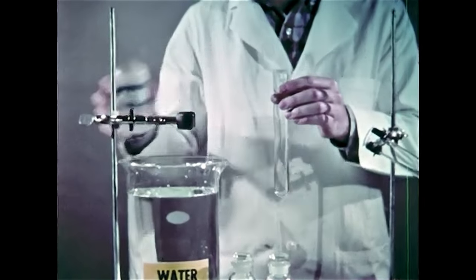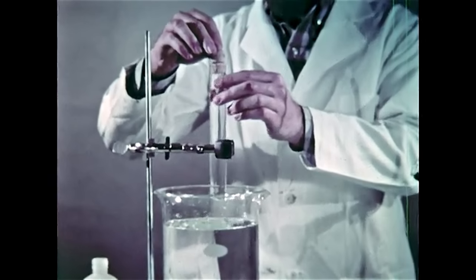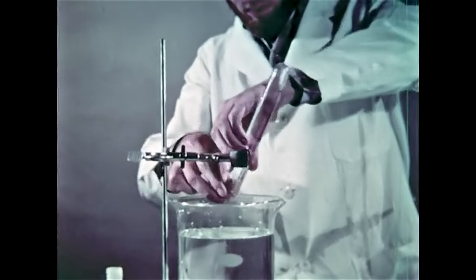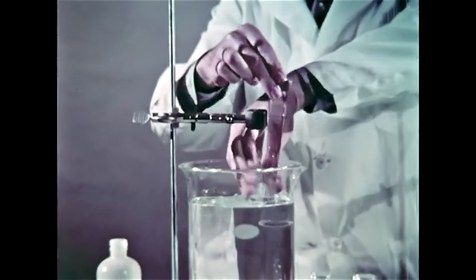By having a tube filled with water for collecting, we avoid mixing the oxygen with other gases in the air that have similar densities. Using the cork is a good method for keeping liquid in the inverted tube.